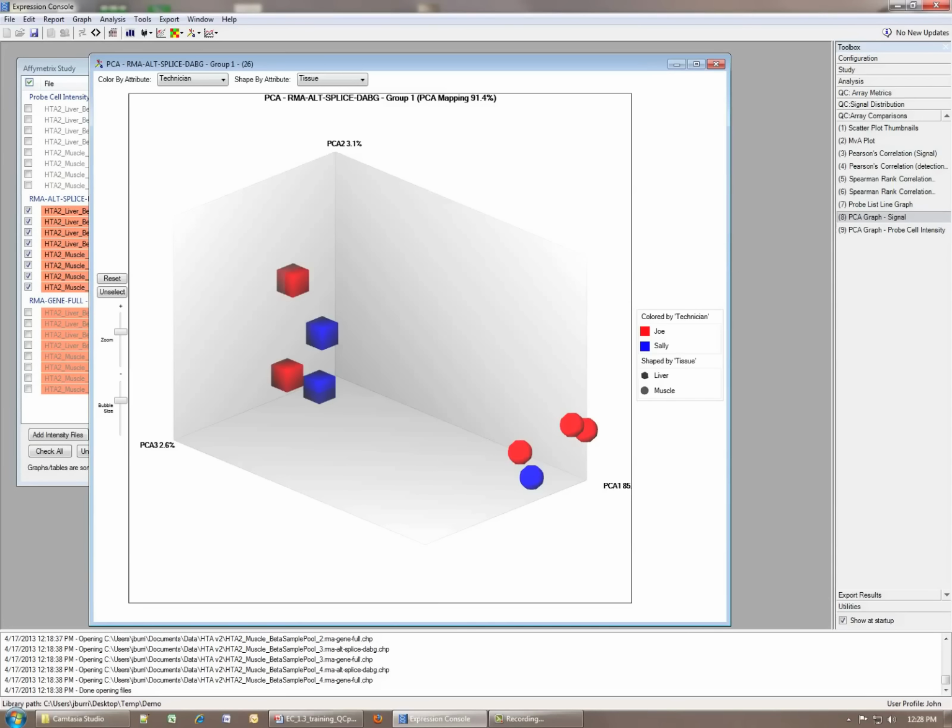The things to be concerned about are if you see these 2 clouds and they're actually based on some other attribute that is less informative to you, technician, date of processing, something like that. Or if you have 4 of your muscle samples over here and 1 of them is over here, and one of the muscle samples that's over here is actually over there, that indicates you have a potential sample swap.